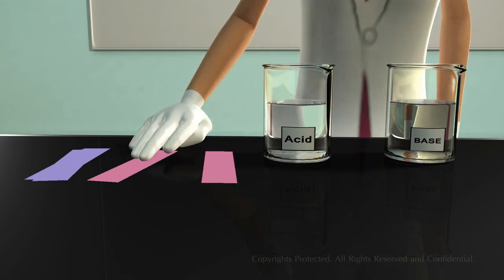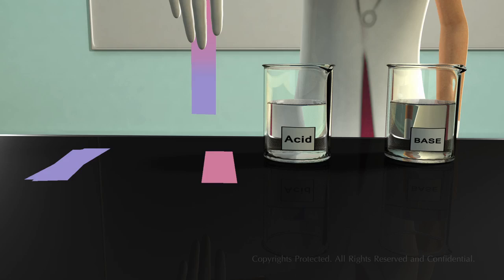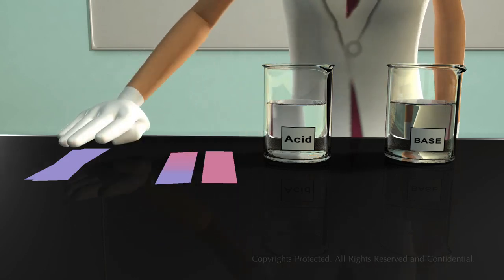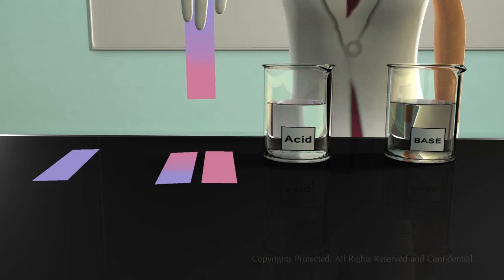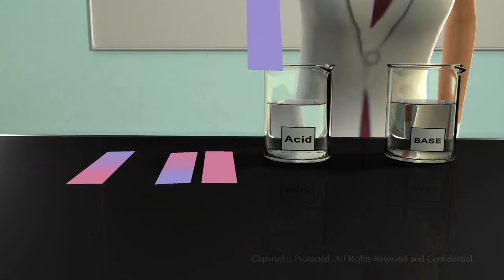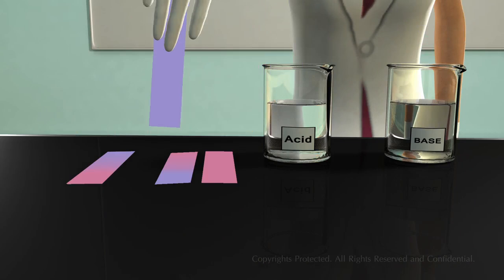Now, let us dip the red litmus paper in a base, and let us observe what happens next. We can see that the base changes the red litmus paper to blue. Now, take a blue litmus paper and dip it in the beaker containing acid. You can see that the acid changes blue litmus paper to red. Now, let's see what happens when you dip the blue litmus paper in a base. You can see that there is no change in the color of the litmus paper.